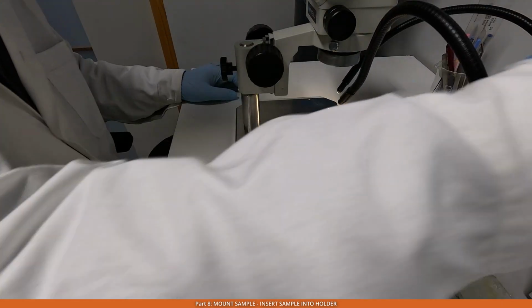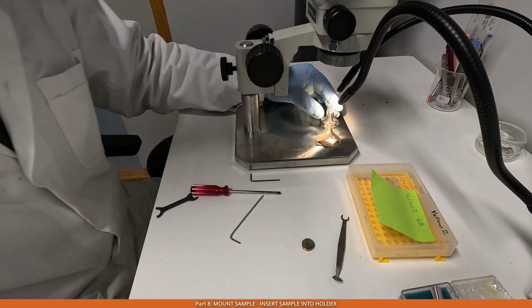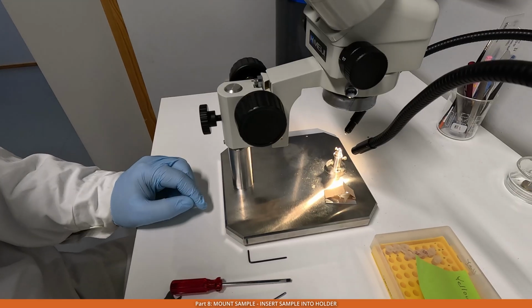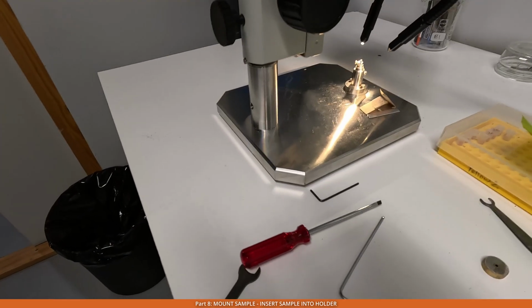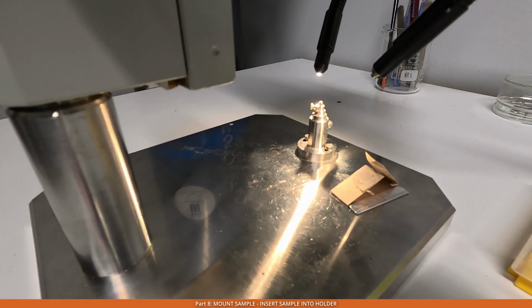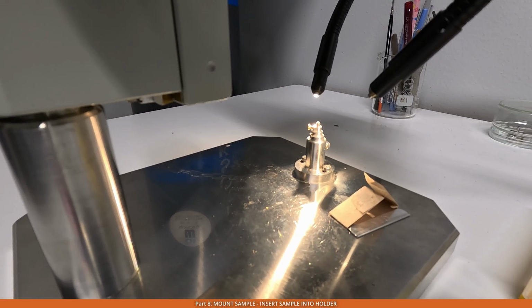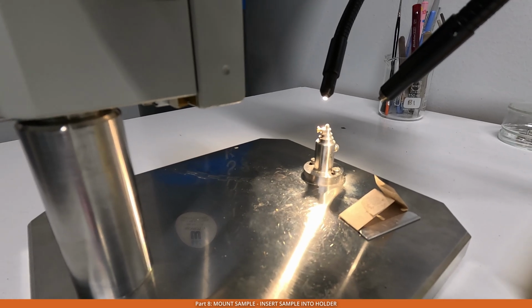So I switched on the light, and then I'll put the sample into here. Okay. Hopefully something is visible. So let me show you like differently. So it looks like this, and then I'll just basically make sure that the center of the block is properly aligned.